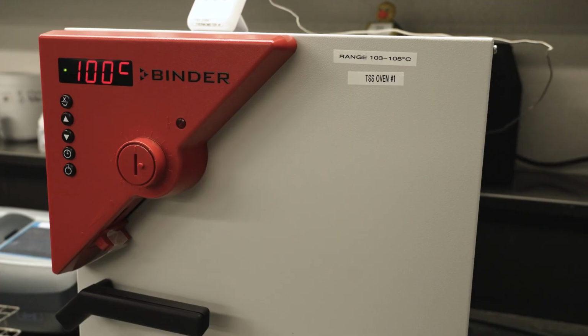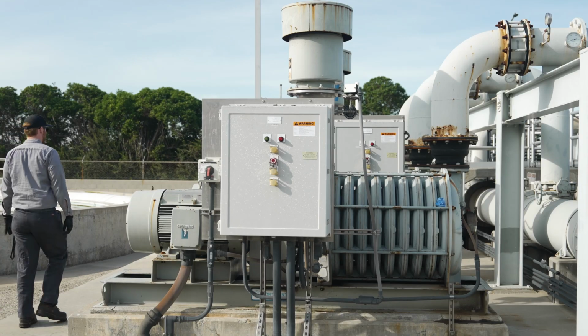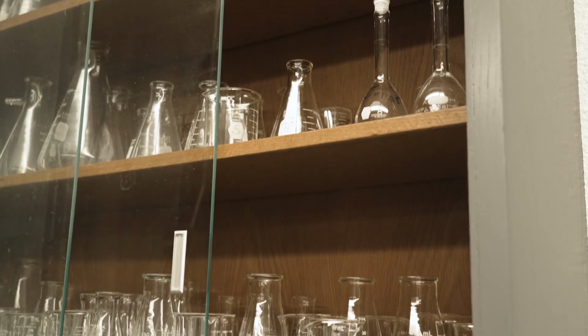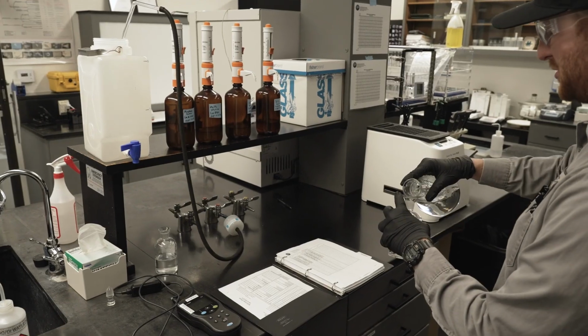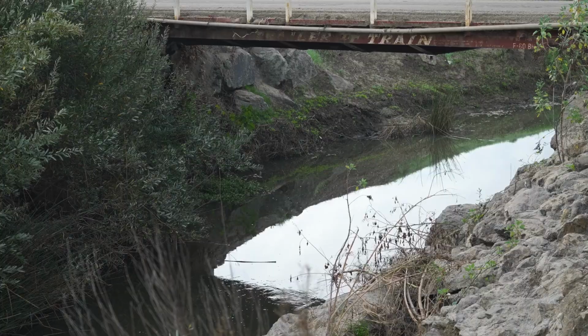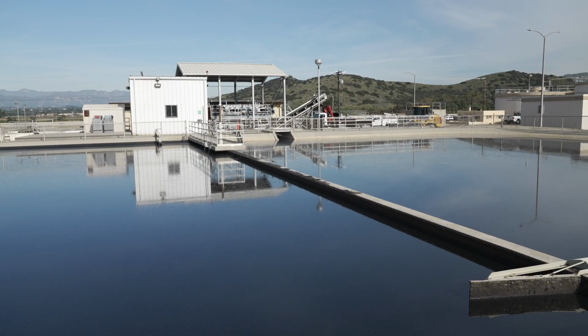So Eric, what does a typical day look like for a laboratory staff here at Camarillo Sanitary District? Well, it's a lot of quality control. Our day usually starts off by checking equipment, temperatures of incubators, calibrating equipment, any other tasks we'll need to get done quality control-wise. Then we get to preparing any test materials we'll need to have ready when samples arrive, and then we get to sampling. We always have to sample the plant every day, and sometimes we'll need to take samples from the Conejo Creek and our biosolids drying beds.